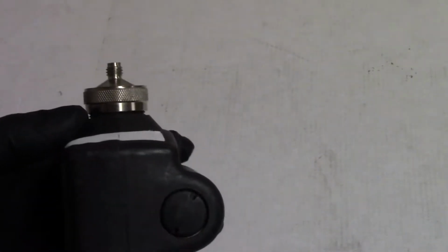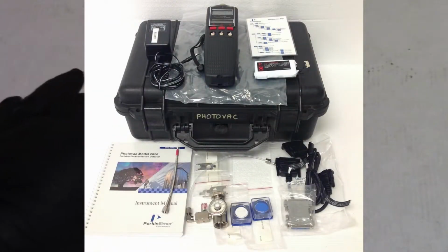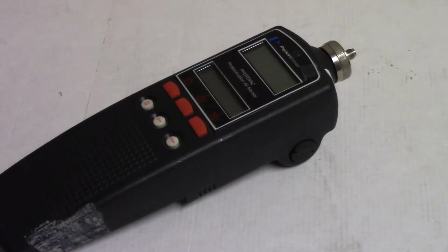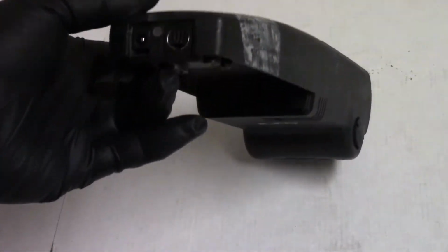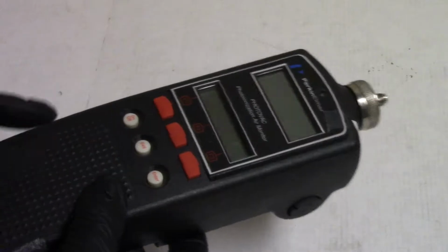There's supposed to be a calibration gas used with these. It's isobutylene, I believe. But there's no battery with this one. There's no gooseneck. There's supposed to be a little gooseneck straw that comes off. There's a whole setup, and you can buy these fully functional for anywhere from $500 to $1,000 depending. Sometimes cheaper, sometimes more. But I got this one pretty cheap because there's no battery and there's no other power supply or anything. This DIN plug down here is actually used to connect to a printer.